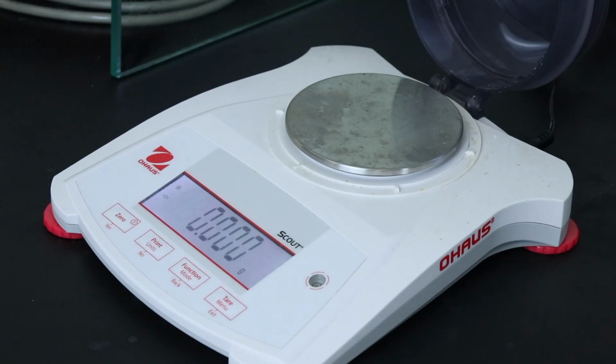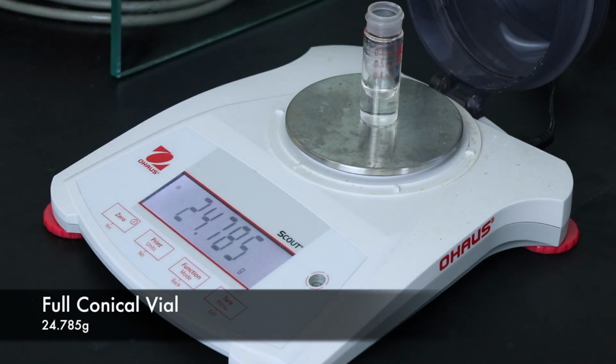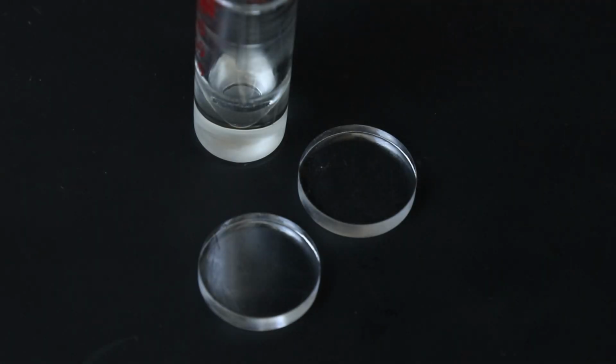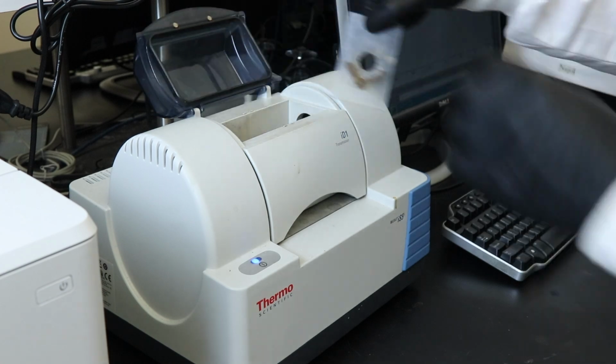I'll first weigh the full conical vial so a % yield can be calculated, and don't forget to correct that yield using the gas chromatography handouts in your procedure. Then I'll spot the salt plates using an open capillary tube and place it into the spectrometer.